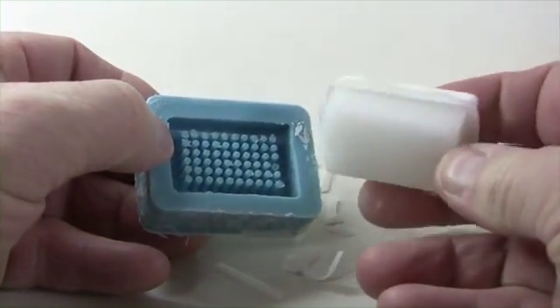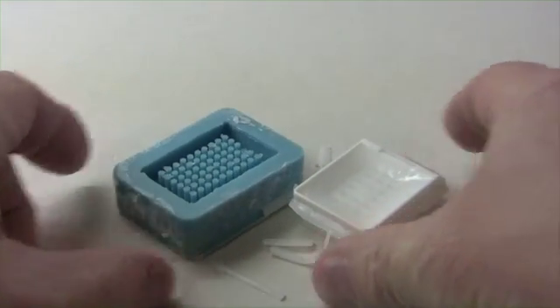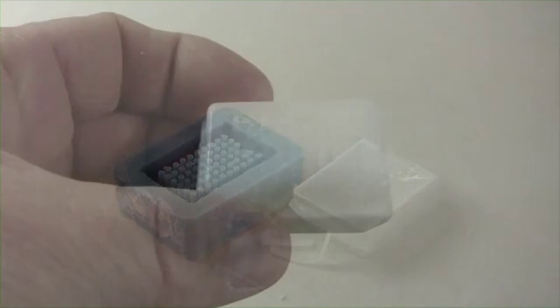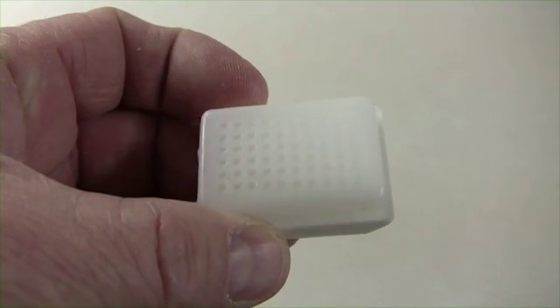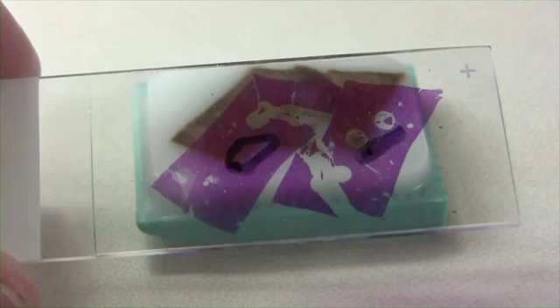The array mold we are using here is one of our first created. As you can see, it came to us with a short core rod in it. Since we couldn't sell it, we have been using it for testing. In the last three years, I believe we've made around 40 to 50 paraffin arrays from this single array mold.